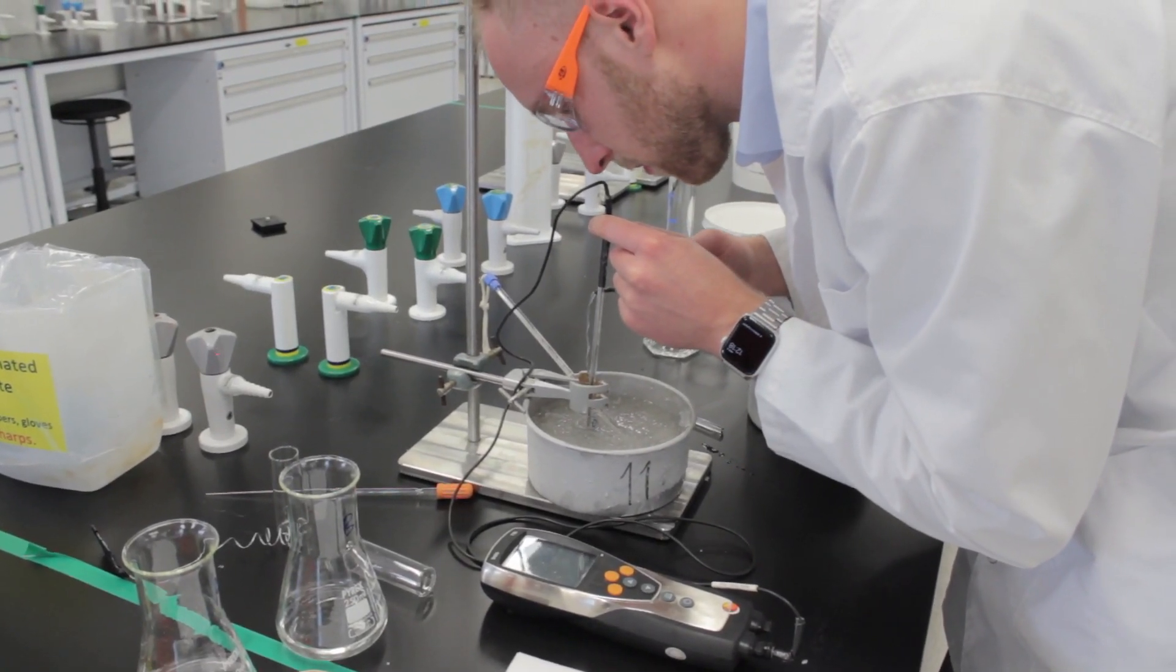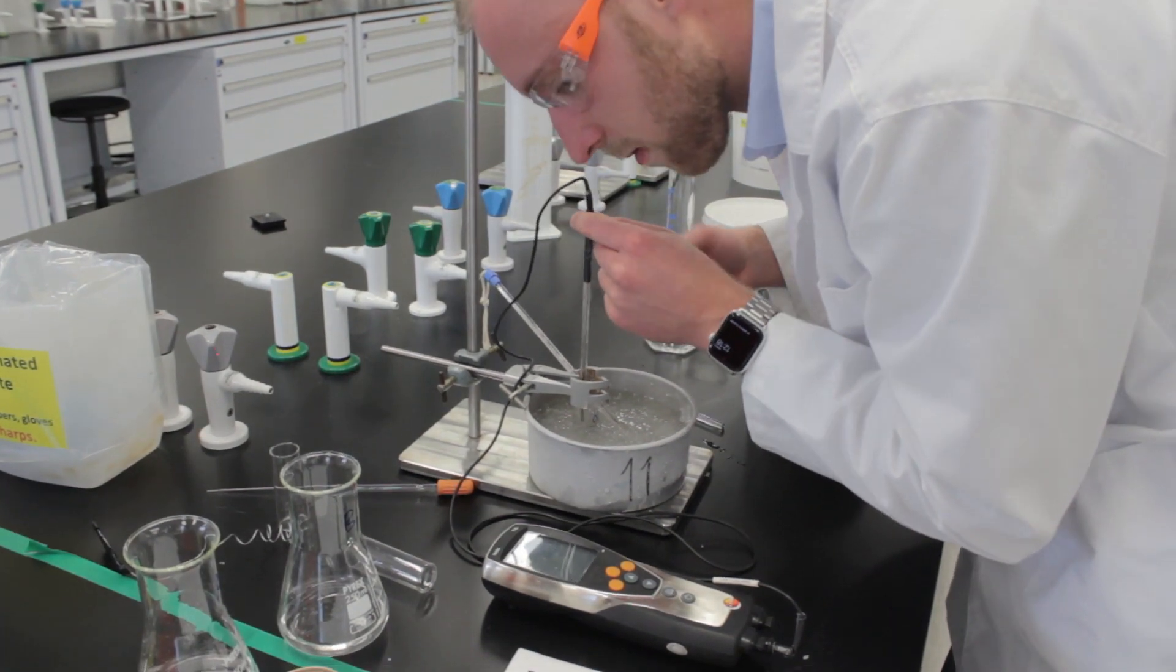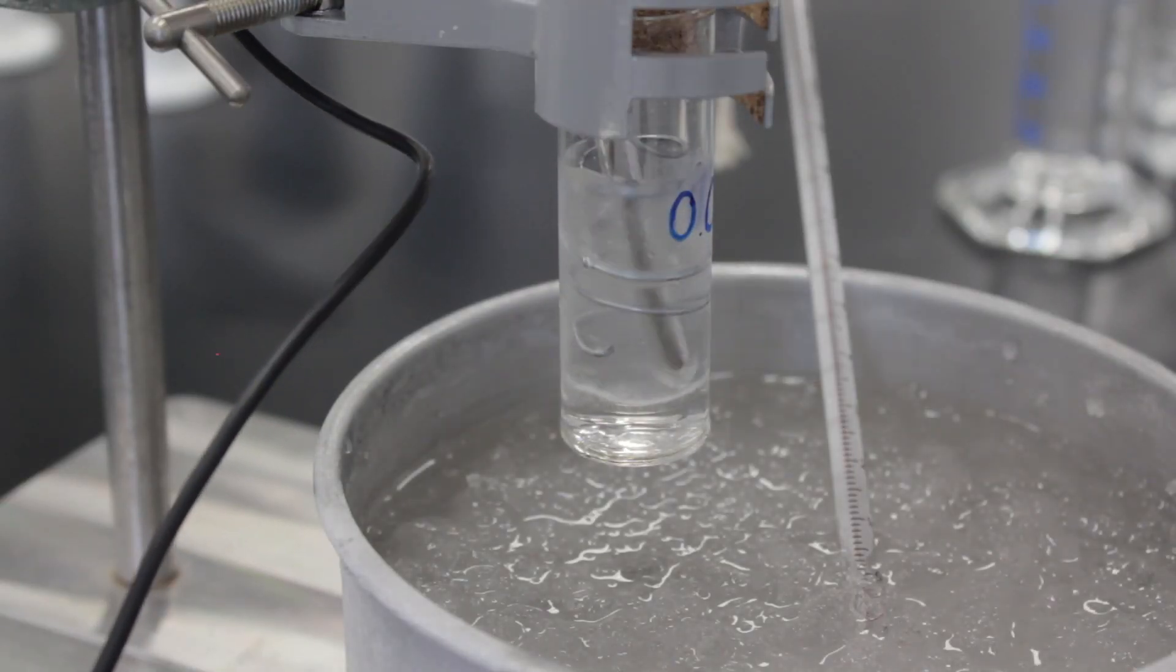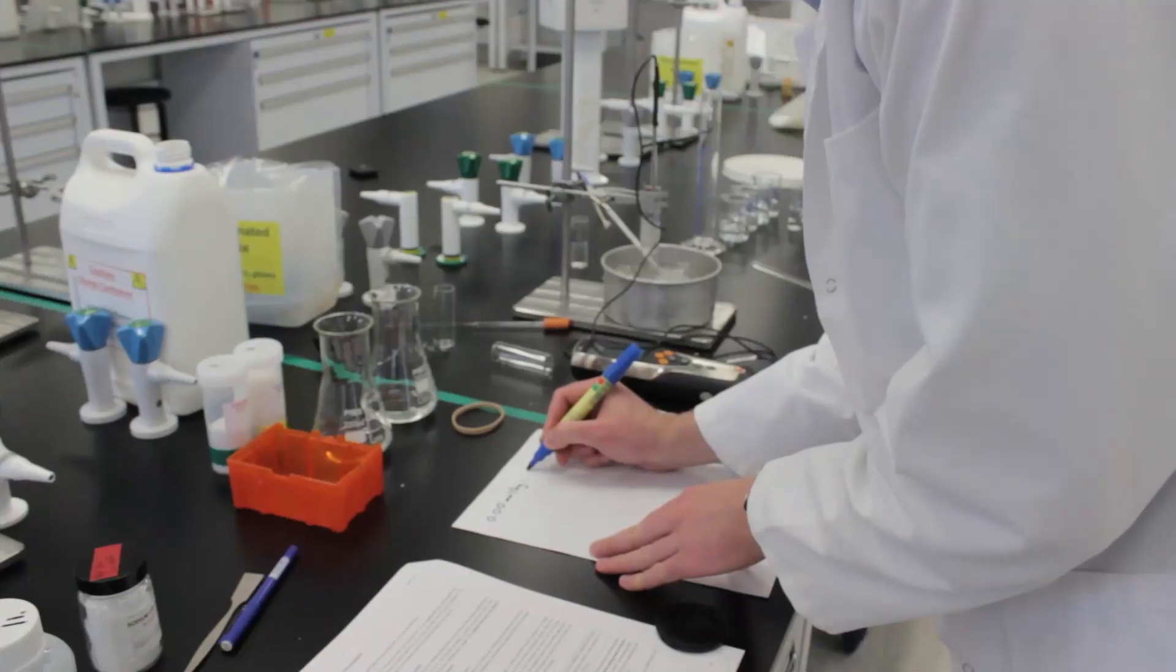The temperature should drop sharply due to supercooling, then increase to a stable freezing point. You should also see some ice forming in your test tube. Write down this freezing point.